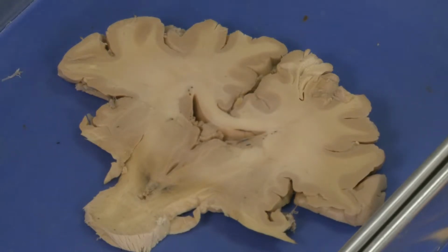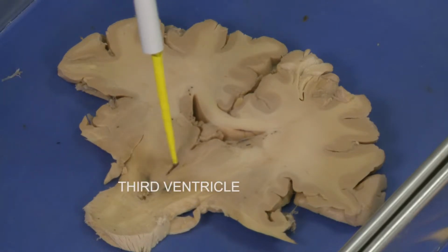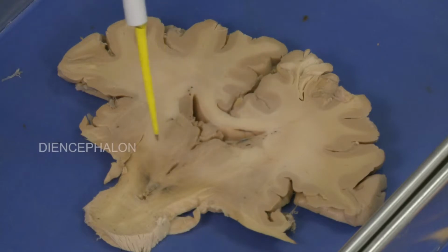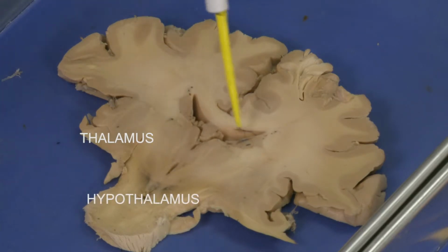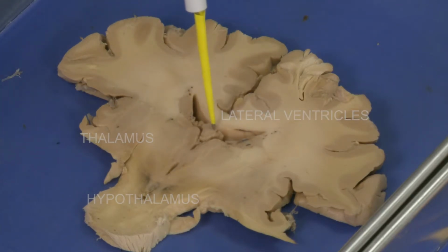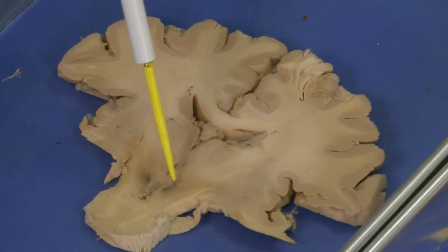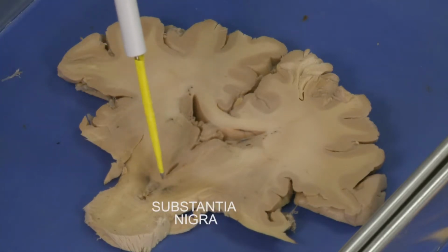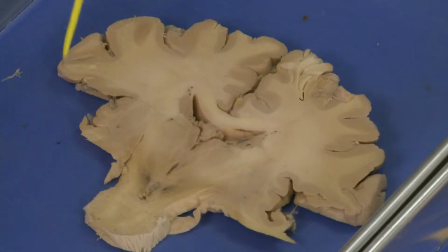But in this section you can see the third ventricle very well. You see the third ventricle is here, and on both sides of the third ventricle is the diencephalon. First you have the thalamus here and you have the hypothalamus here. Lateral ventricle, and this is the fornix, another structure of white matter which connects different parts of the brain. So that is the substantia nigra and red nucleus, and this is the pons. What is missing here is the hippocampus, which I showed you, which is still intact in the brain.